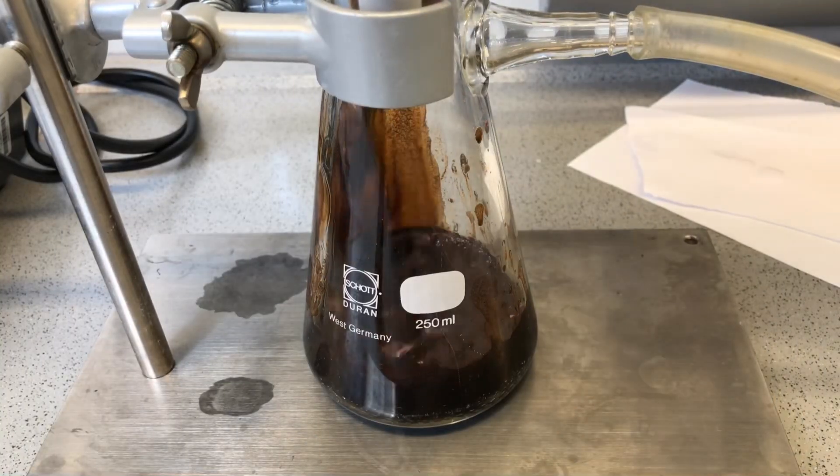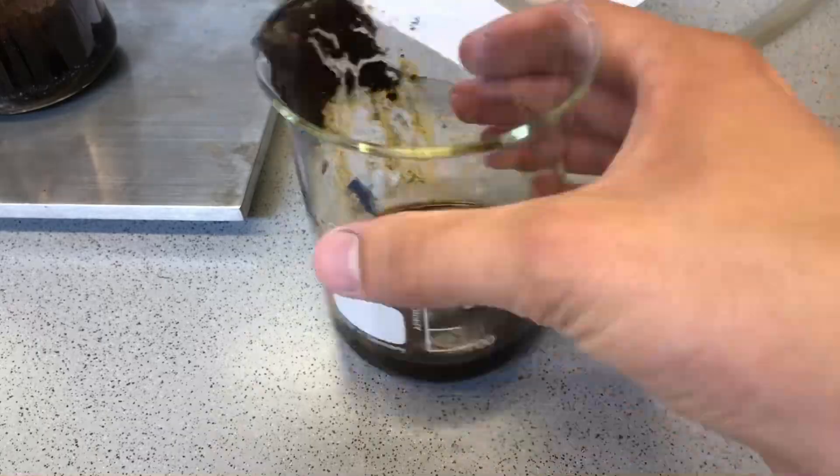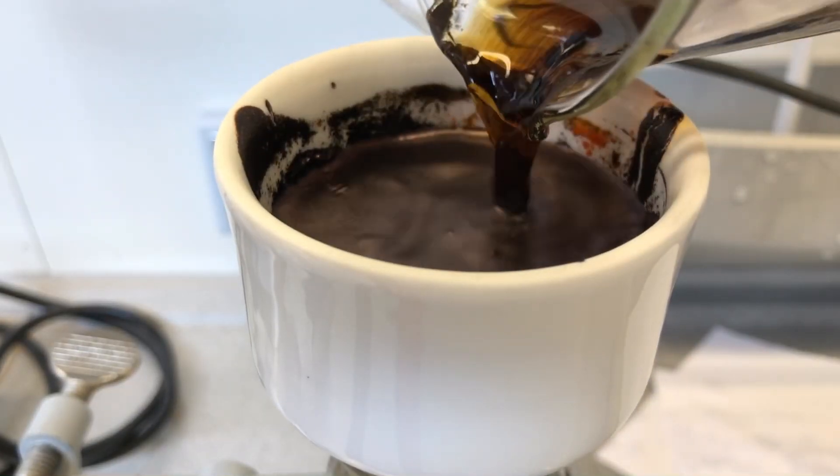We let everything stand for about 10 minutes to make it somewhat fully react. Afterwards, a vacuum filtration was performed. The product was washed a single time using 45 milliliters of distilled water.